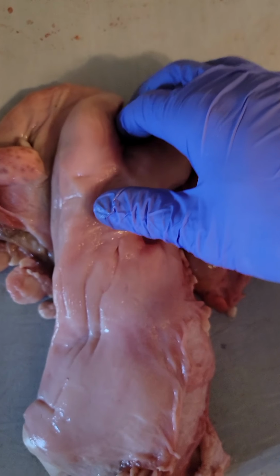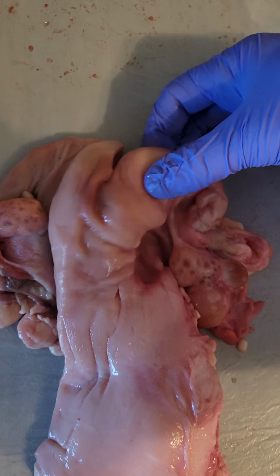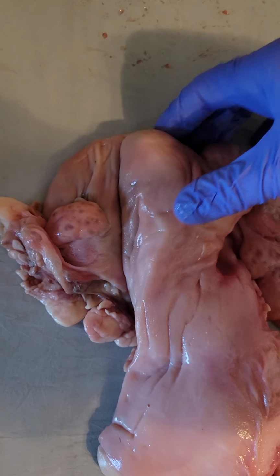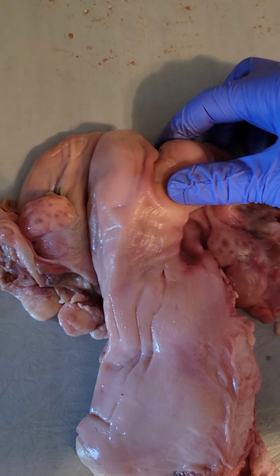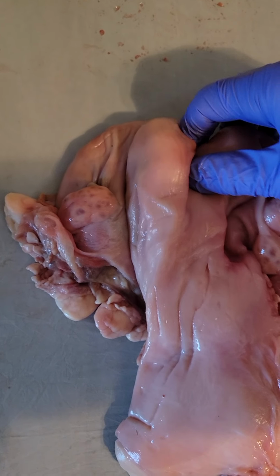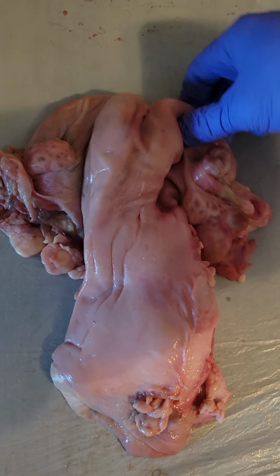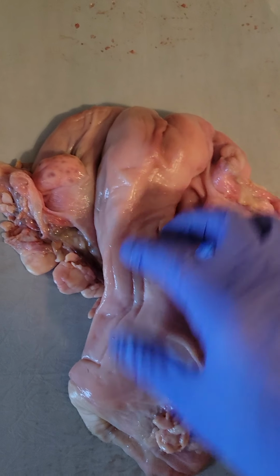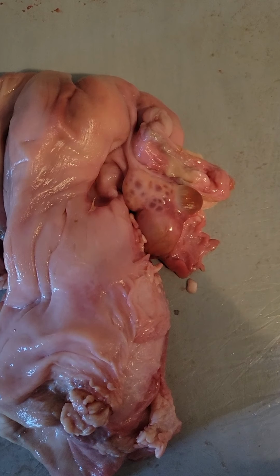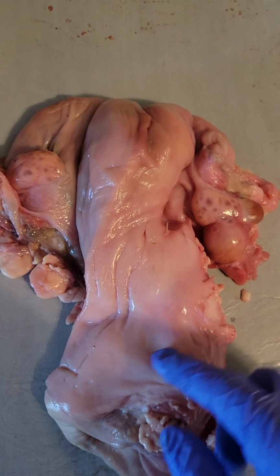Different kinds are the duplex, which is typical of rabbits and marsupials, and then simplex, which is more like what humans have, where there's almost no development of a uterine horn, and then bicornuate, which is what most mammals are, where you have distinguished uterine horns of varying levels, and then a uterine body before it enters the cervix. Again, I will cut this open once I finish through.